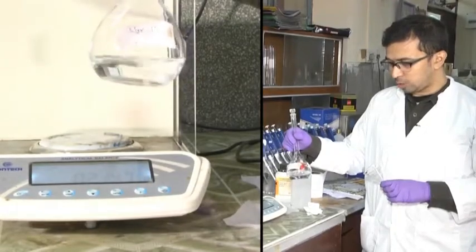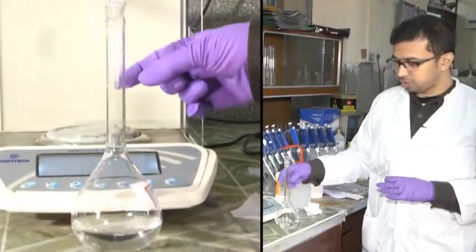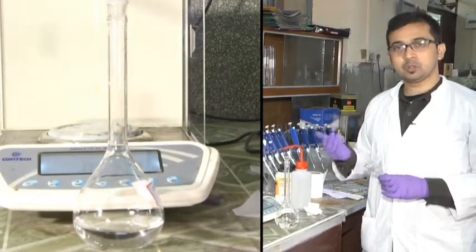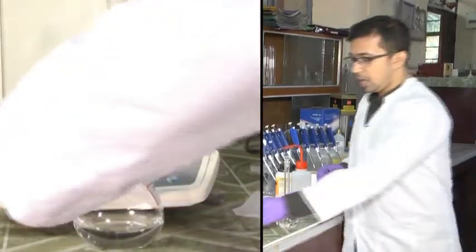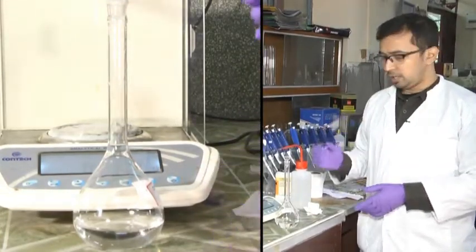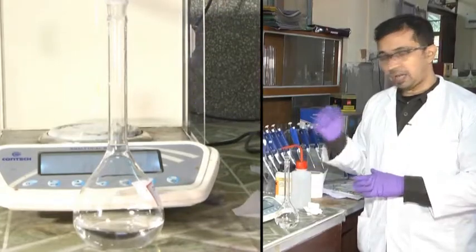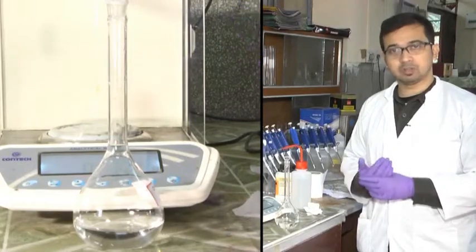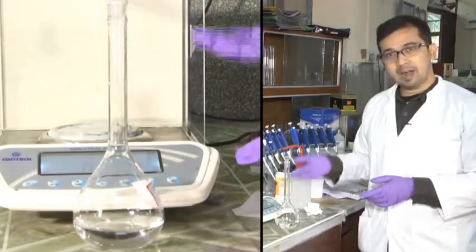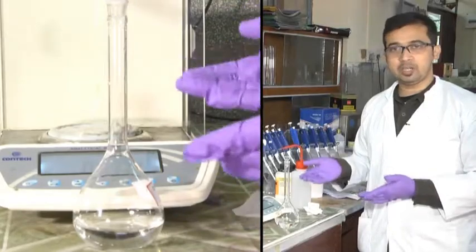The solution is almost clear and the oxalic acid has dissolved in the double distilled water. Now we have to fill it up to the mark. In a 250 ml volumetric flask there is a mark at 250 ml — we will fill up to that mark. Do not add 250 ml of water through a measuring cylinder directly and then add the sample. Due to volume error, the total volume of the solution might increase a bit. It is better to add the sample first, dissolve it with a little water, and then fill the total volume with double distilled water up to the mark.